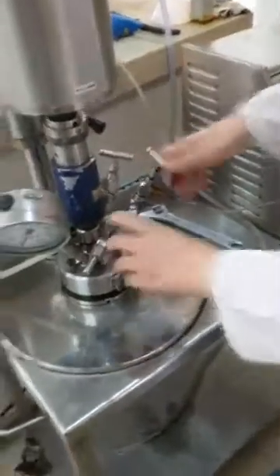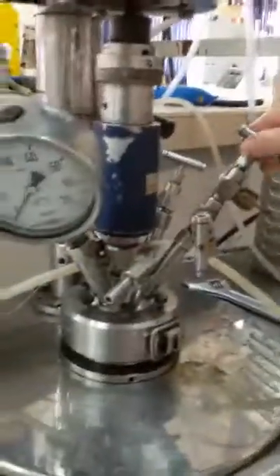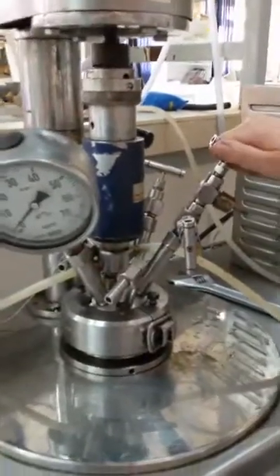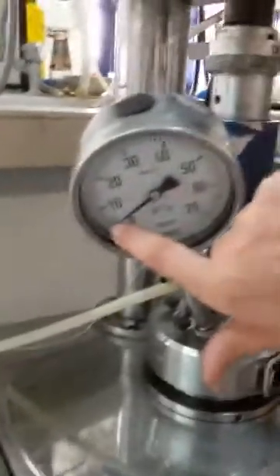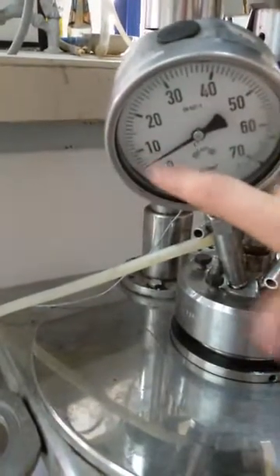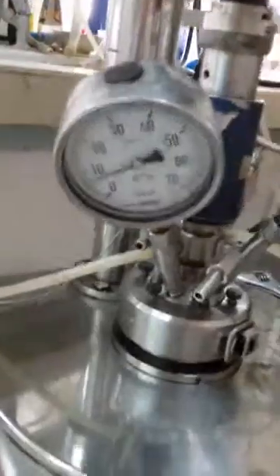For the gas flowing from here, I have the pressure gauge right here — it is open. It is open on the pressure gas side. I just need to open the gas valve right here. And you can see the pressure raised to the level I want, up to 10 bar.